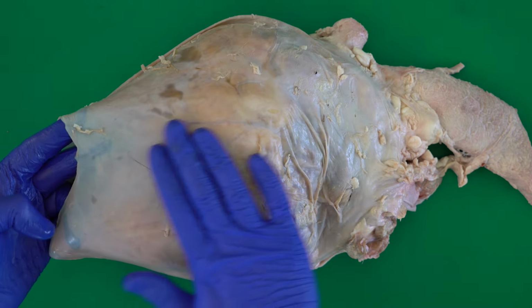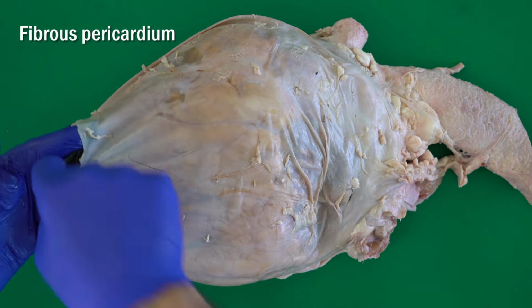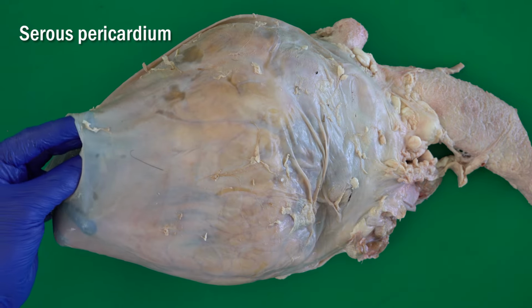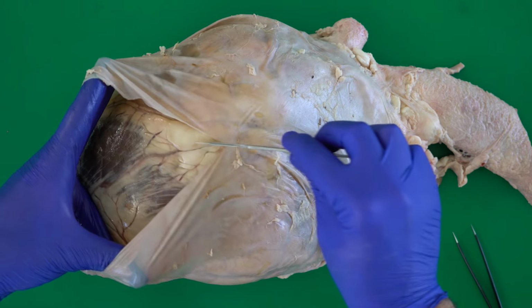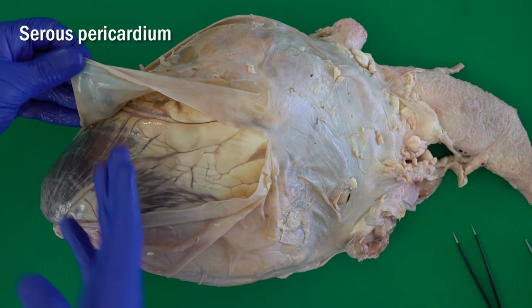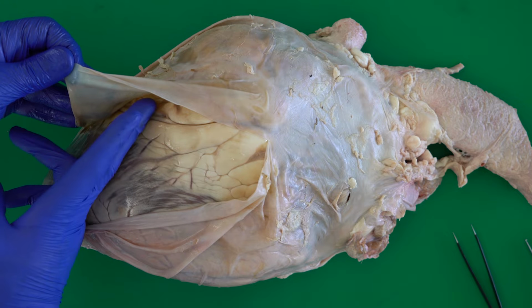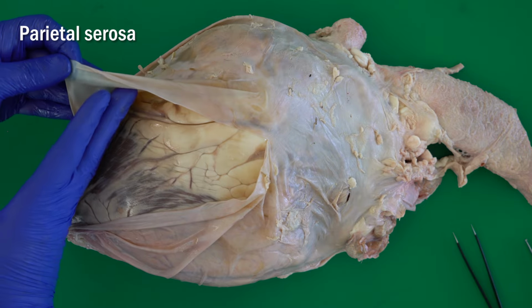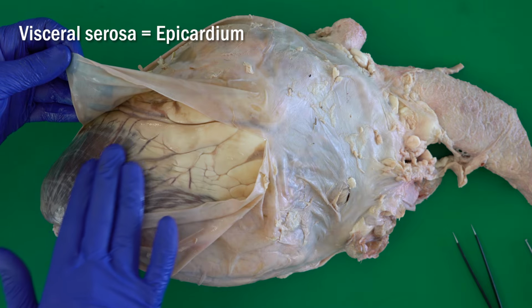The outside layer here is the fibrous pericardium. And internally we have the serous pericardium. The fibrous pericardium, as the name suggests, has a lot of fibers. The serous pericardium again has two layers. The layer which covers the sac from inside is the parietal serosa, and another layer covers the heart directly, called the visceral serosa.